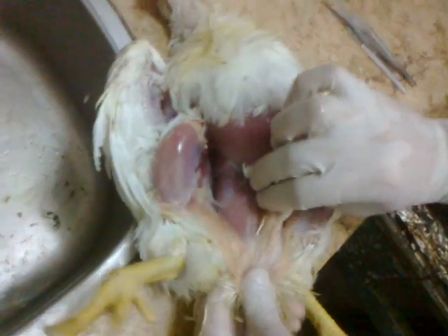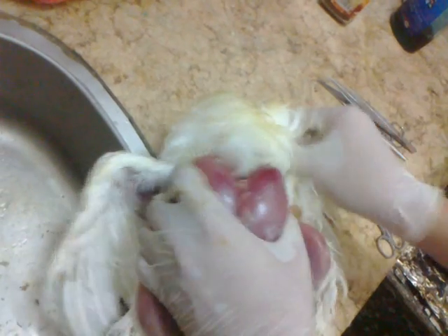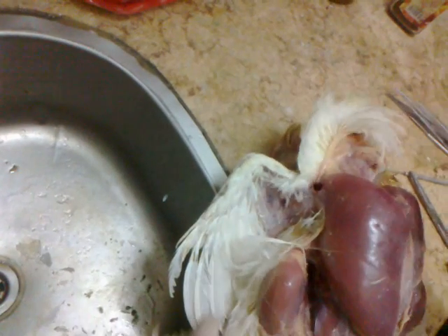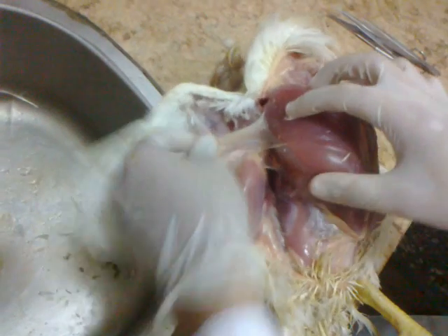You reflect the skin very well, then reflect it again. Tearing of the skin is a sign of disease, especially hypovitaminosis A or heat stress. If tearing of the skin is very easy and occurs readily under your hand, this indicates disease.